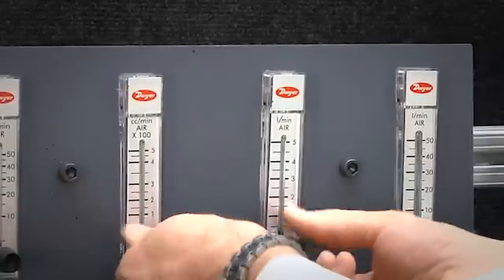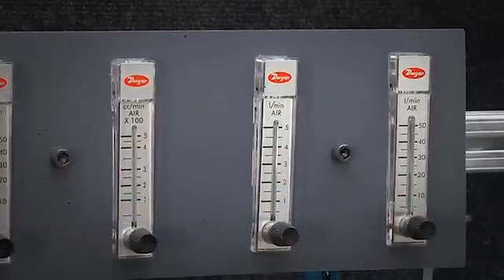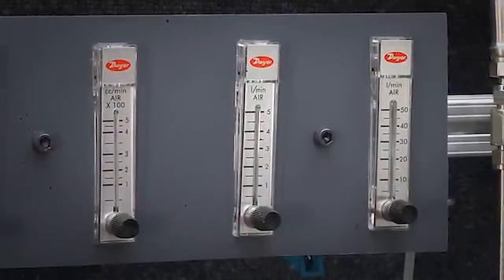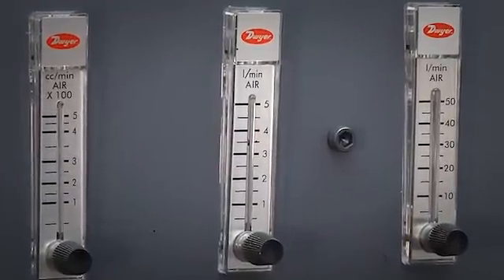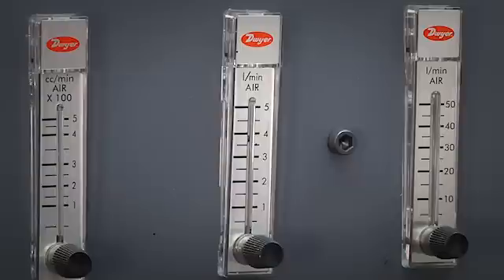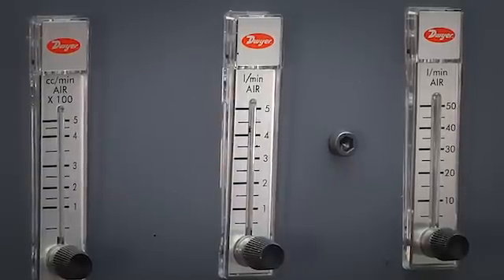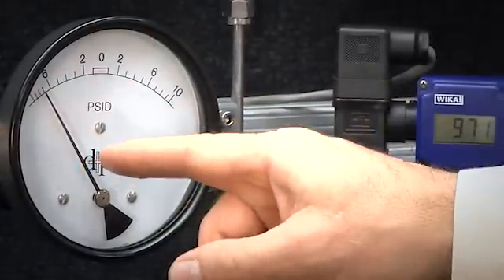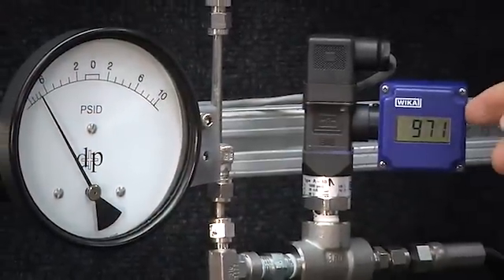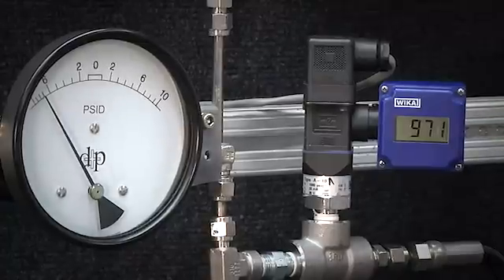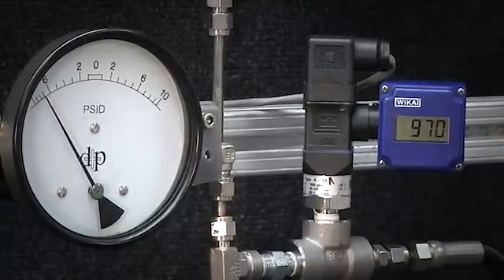Let's go again to 4,000 cc's per minute or as it is listed 4 liters per minute. Adjust the valve. We are coming up to about 4,000 cc's per minute or 4 liters per minute and we are still reading about 7 to 8 psi and 971. So we have picked up another psi, maybe a total of about 2, 2 and a half, 3.